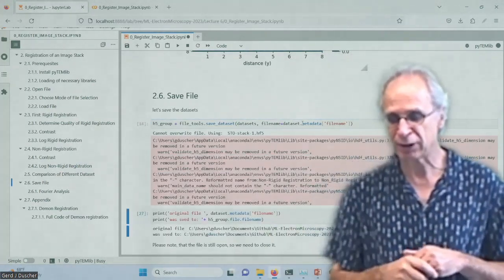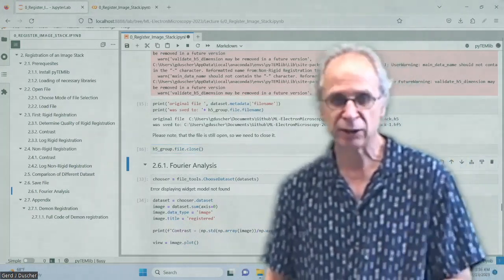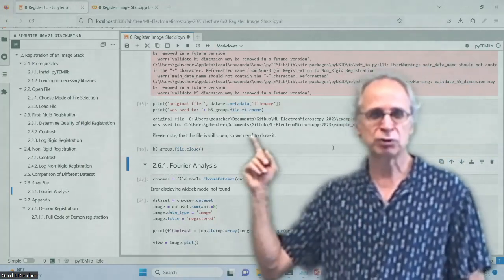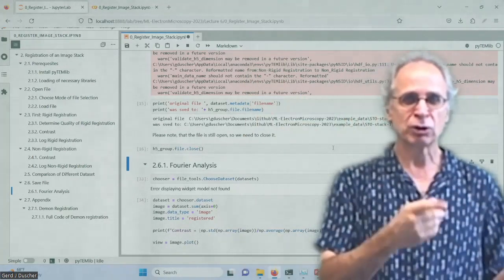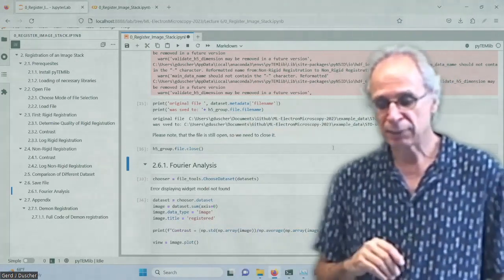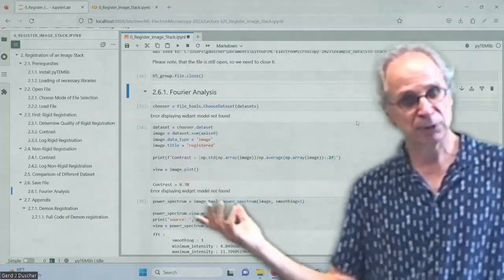Just save it to the same area where we had that. And we can check it out where we put that. And ideally, we would close that so that we can use it in a different notebook. Now, the way our Google Colab works, we cannot use this file because now we would have to upload it because I have it on my computer. If you did it on your computer and you start Colabs and it is actually a new instance, then you would have first to transfer it either to your computer and then backup. So we're not going to do that. What we are going to do is we are using ones that I did before for the next notebook.